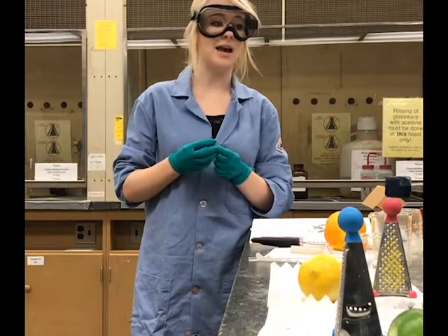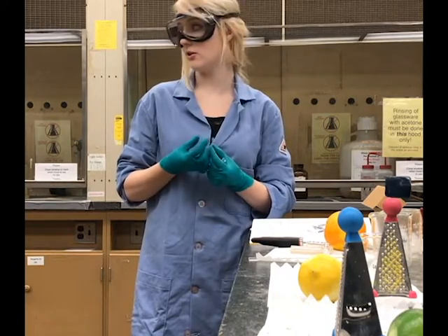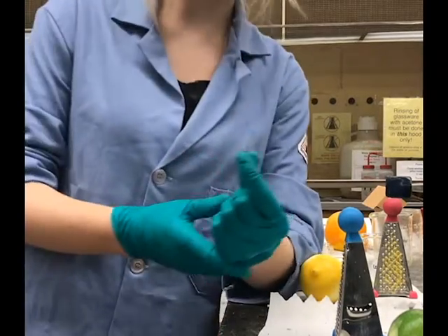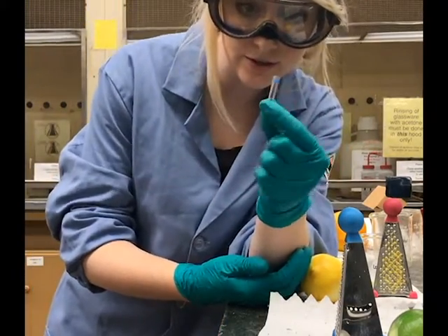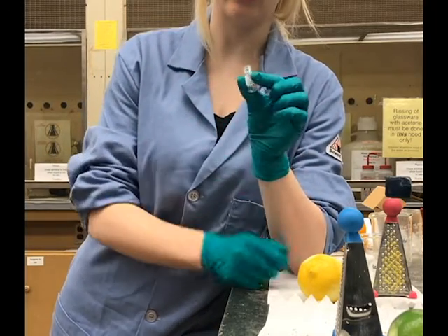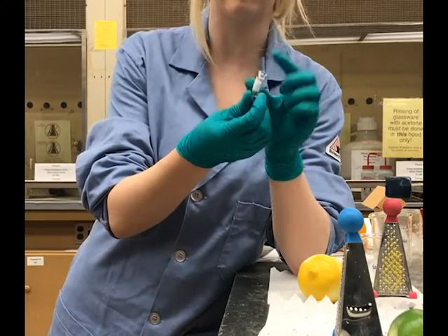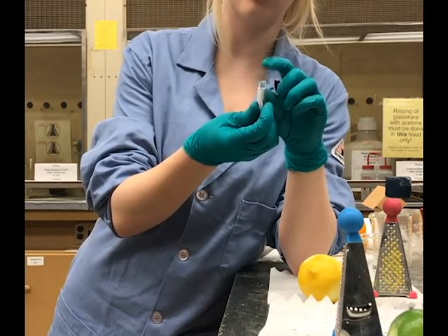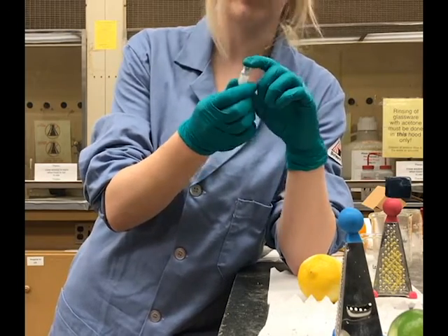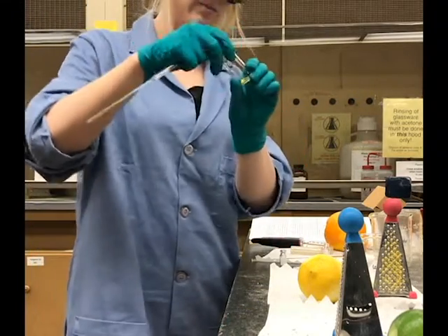All right, so now that we have all of our solutions prepared, we will go ahead and assemble our samples for GC analysis. So this small tube right here is called the insert. The reason why we place these inserts into the gas chromatography vials is so that we can actually reuse these vials. The inserts are one use only and they're disposable. We will be disposing of them after making our samples. All right, let's start with the grapefruit.